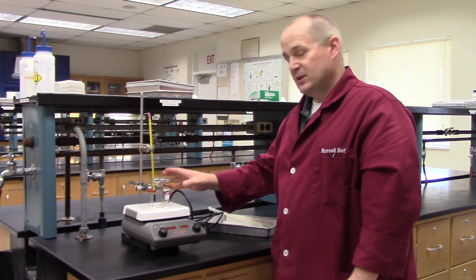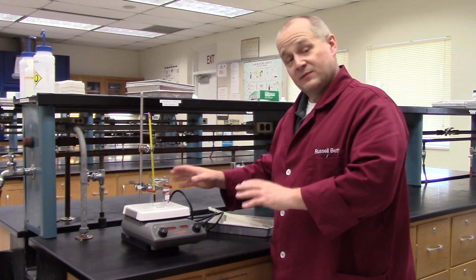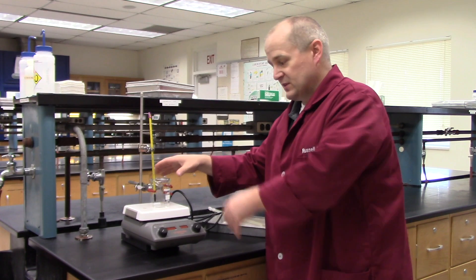Why am I being so insistent on this? Because it's very dangerous — this can really hurt you. I have it clamped so that if someone were to bump into it, it will not tip over and the material will be safe inside the flask.